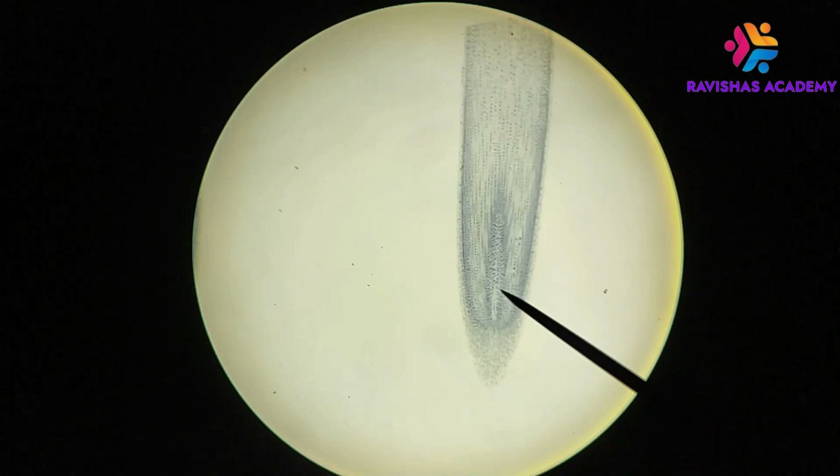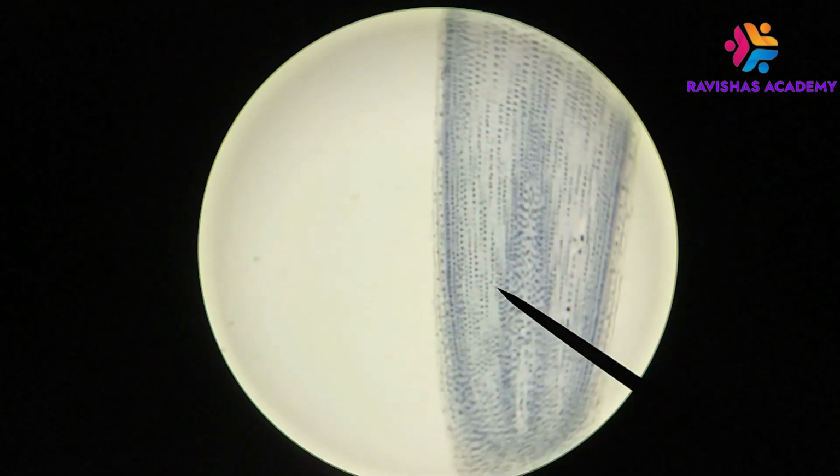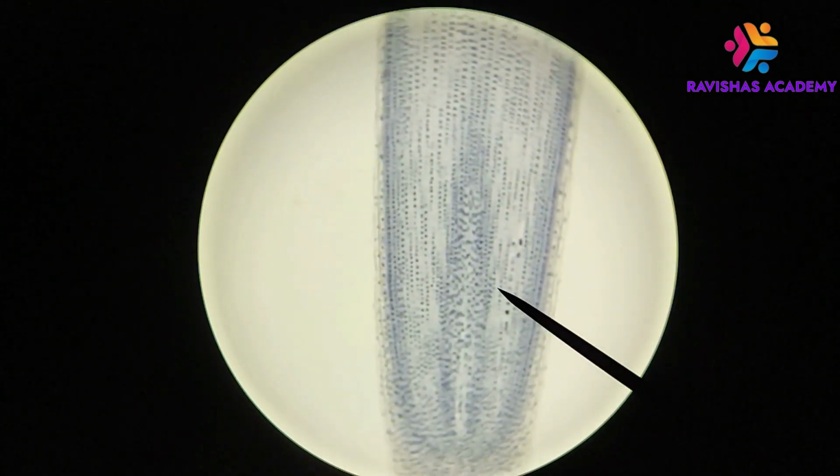So having looked at this at the lowest magnification on this microscope, so right now I'm using the 4x objective, that means that the total magnification that we're looking at right now is 40x. I'm going to switch over to the 10x objective so that we can zoom in on this a little bit. Here we go. And so you can see how we've magnified this substantially.